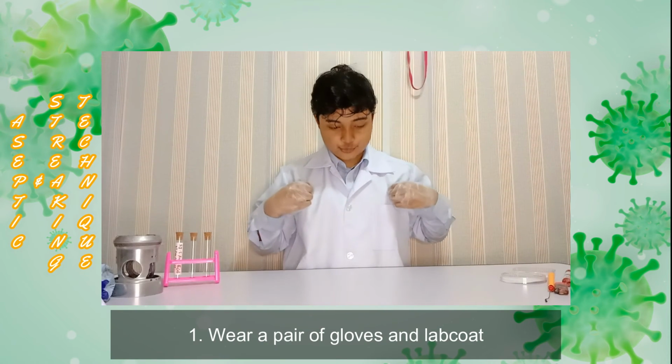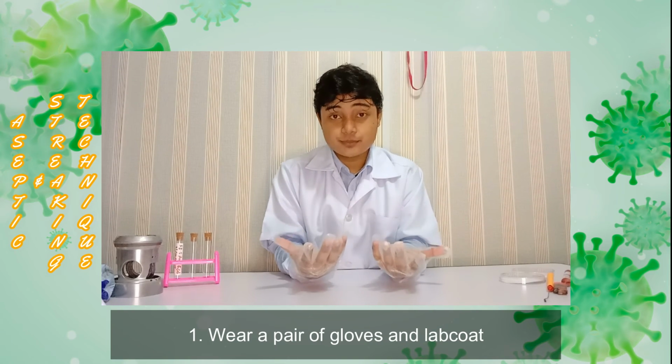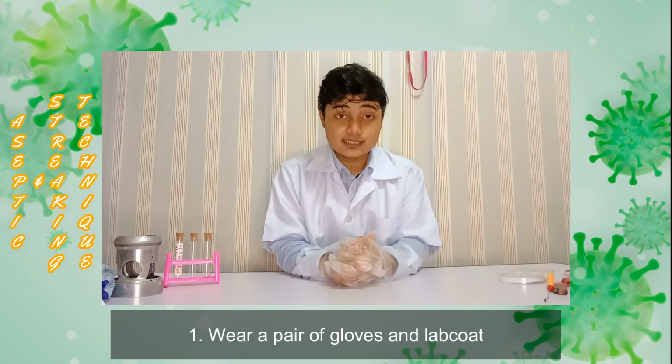So let me recap the very important things, or precautions, that we need to make sure we do during our experiment. First, we need to make sure that we wear a glove and a lab coat during the experiment. This is to prevent infection or contamination during and after experiments.